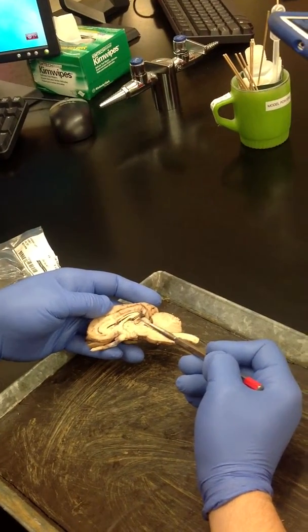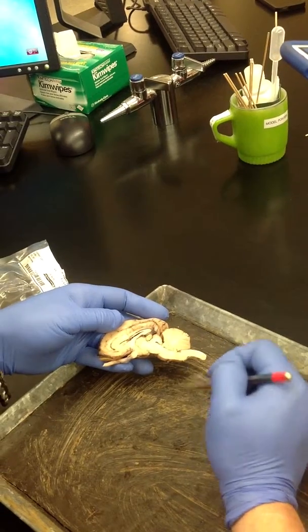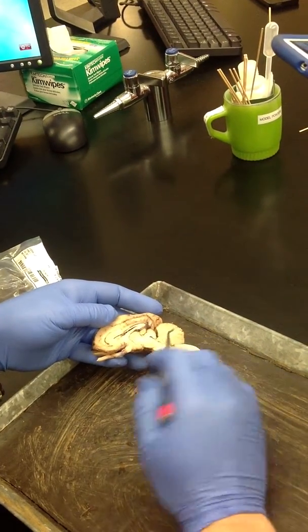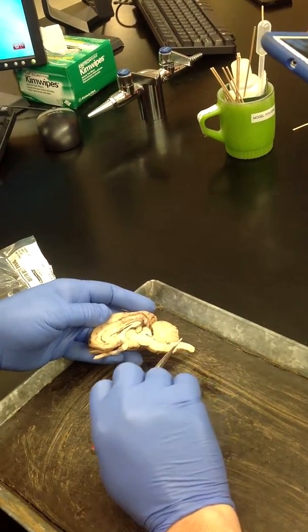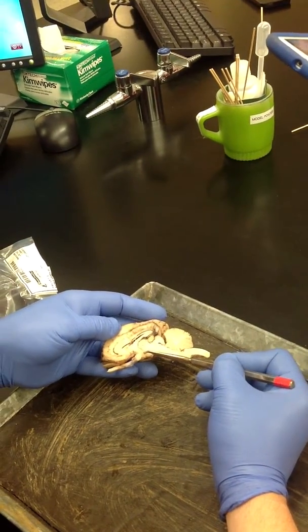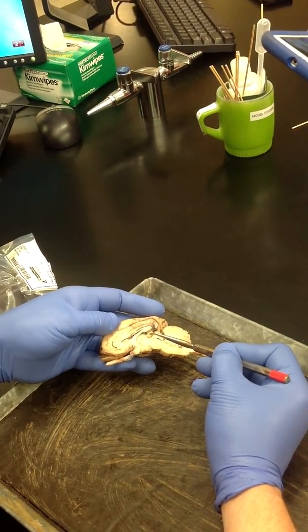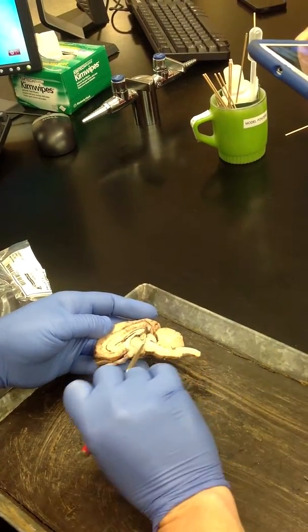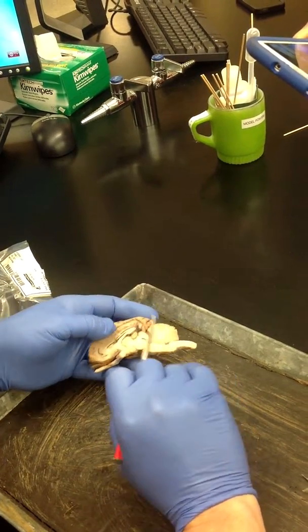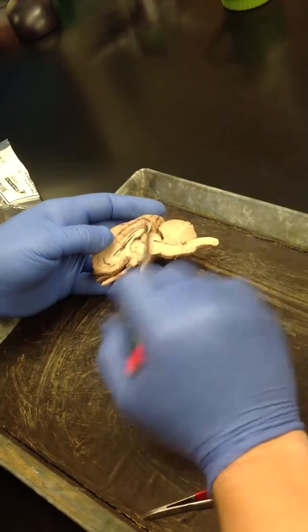If I'm questioning whether that's the pineal gland or not, the way I always tell is I look for my colliculi. The colliculi are actually in the brainstem. So this area is the diencephalon: the hypothalamus, the thalamus, and then the epithalamus where the pineal gland is. We go next into the brainstem, and again, I'll show you how the colliculi and the pineal gland come together.